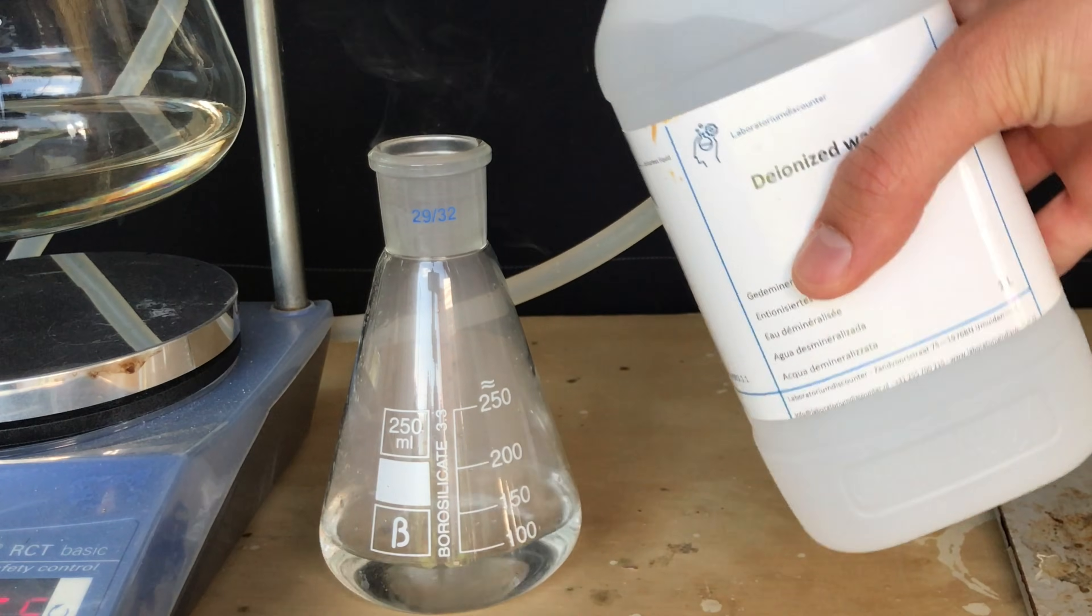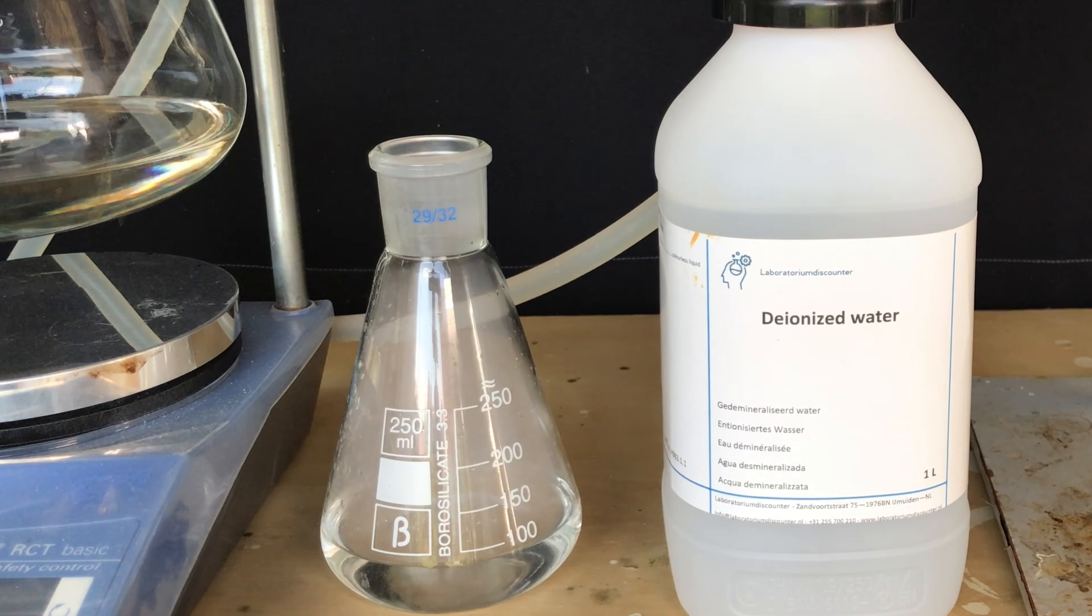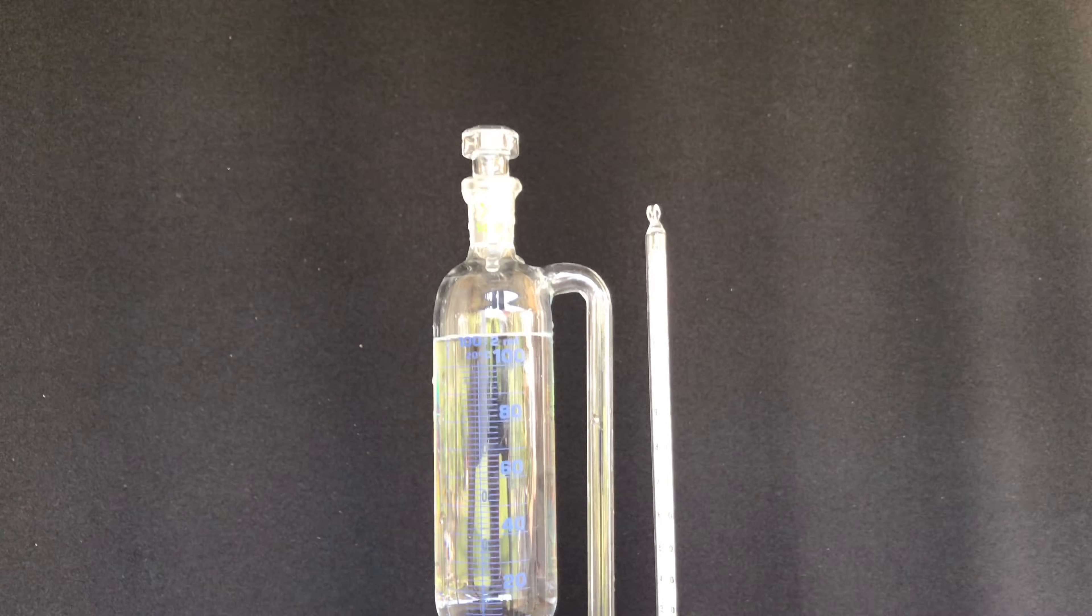On screen you can now see what happens when you add water. Propionyl chloride instantly hydrolyzes and forms propionic acid and hydrochloric acid.